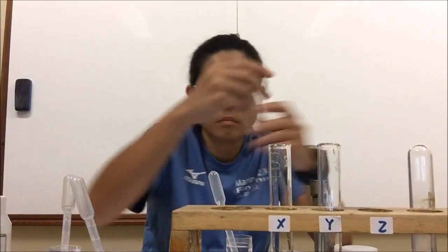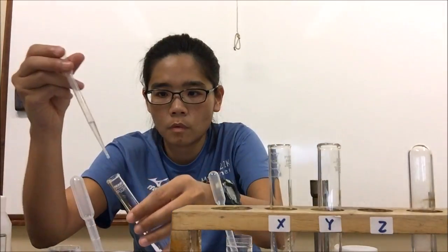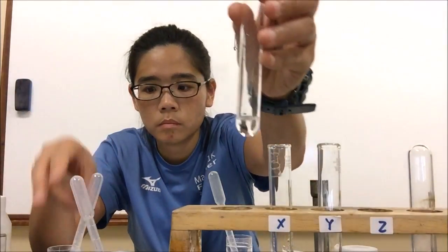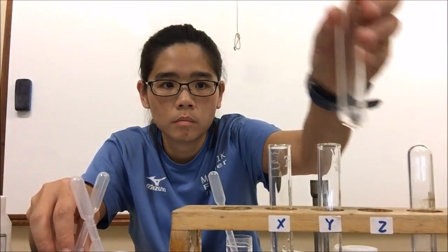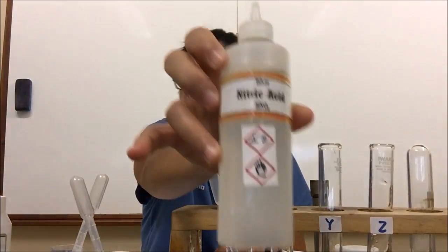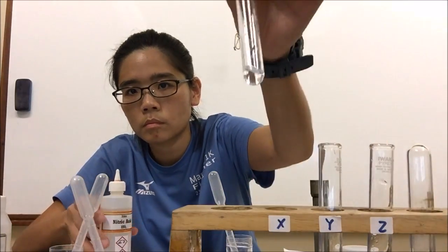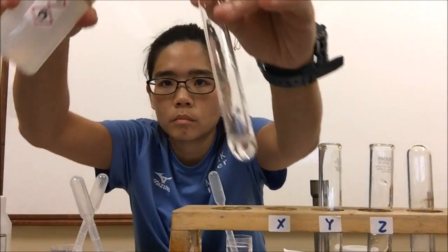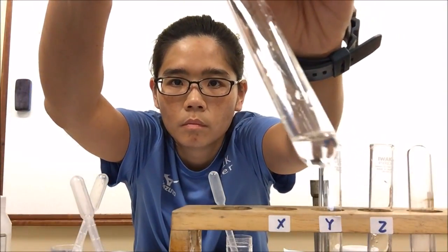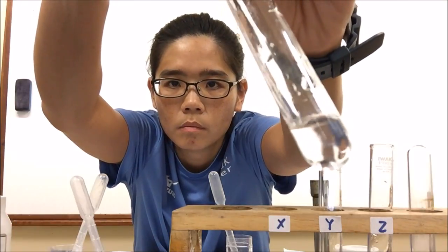Then I add nitric acid and look out for any changes to the colorless solution. For solution X, I add the nitric acid and then shake to mix. The colorless solution remains for solution X — no change observed.